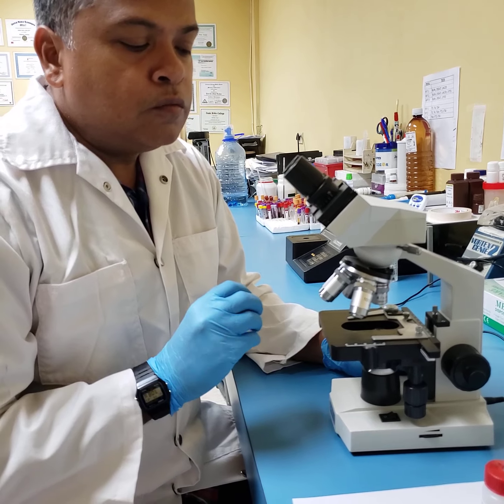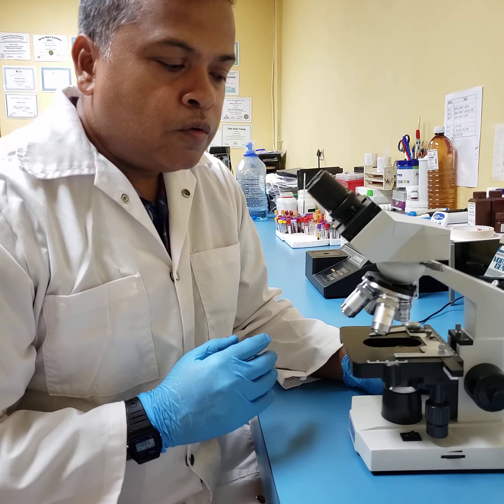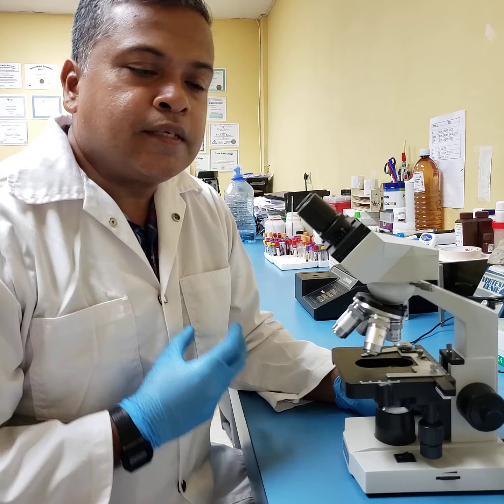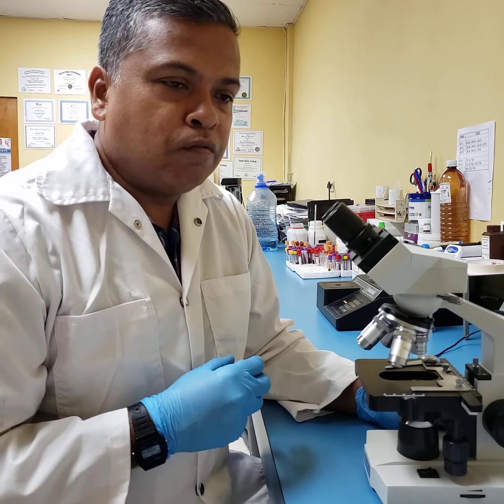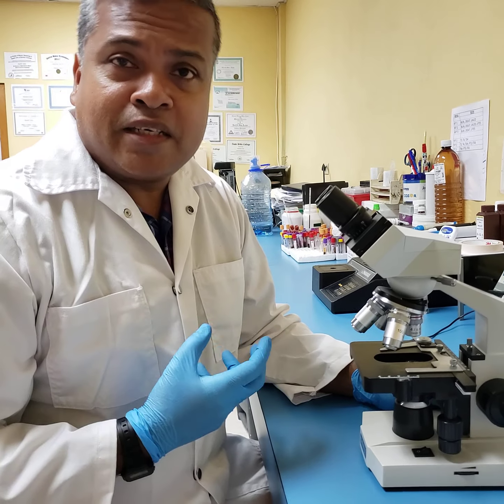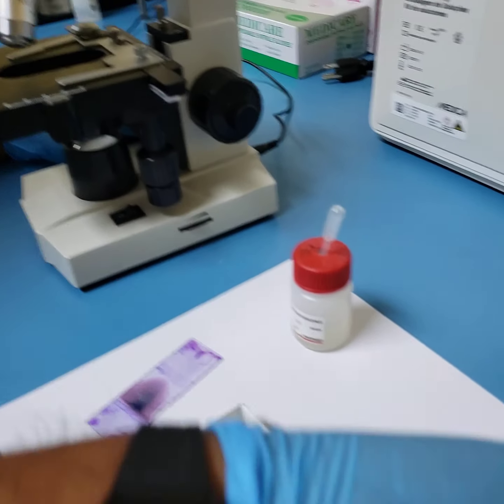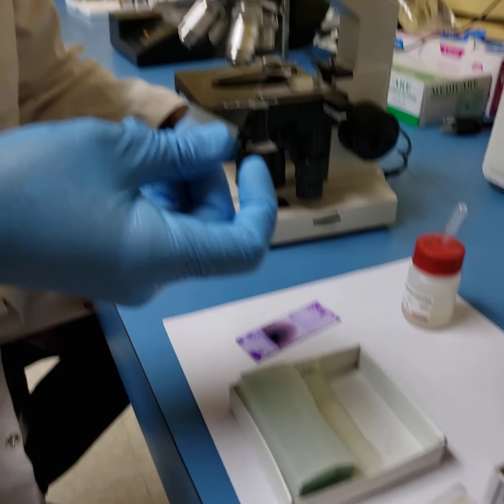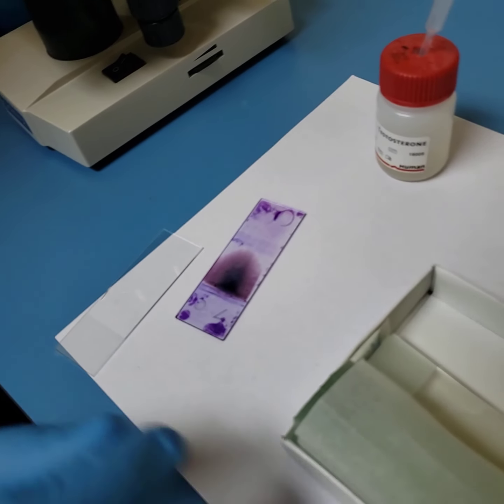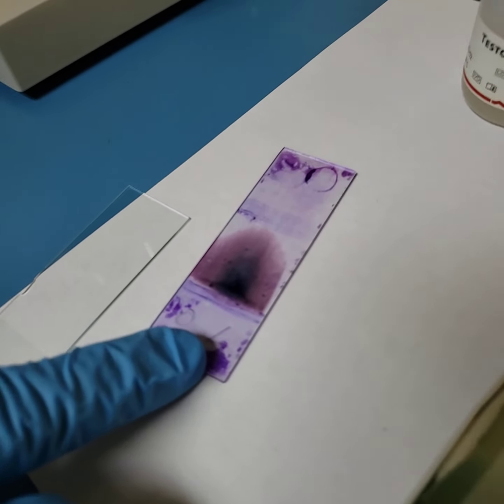All right, now what I want to do is to go step by step through the recommended way for you to do microscopy, regardless whether the sample you are looking at is stool, saliva, semen, sputum, even colonies of a bacterial plate. It doesn't matter. Once you've got a standard slide to which a sample has been placed, you must use a particular format in microscopy. What you're looking at here is a hematology smear that was stained. I will use this for the demonstration today.